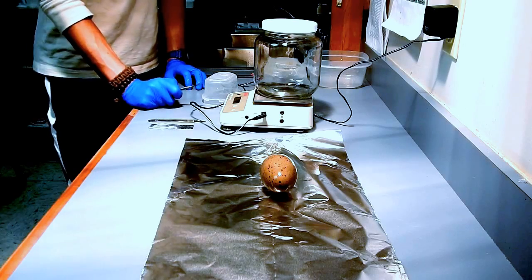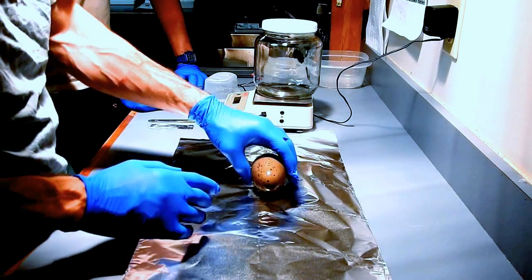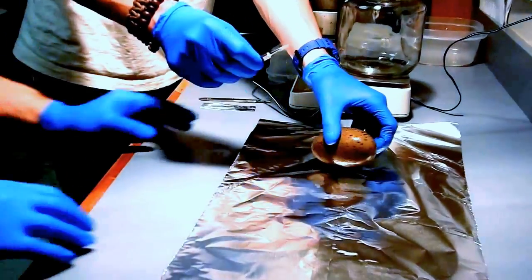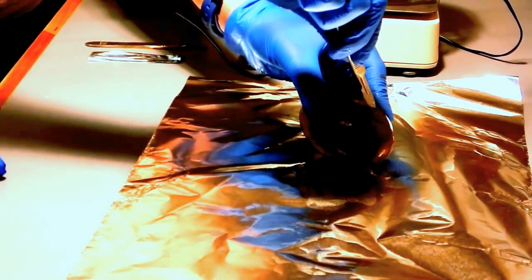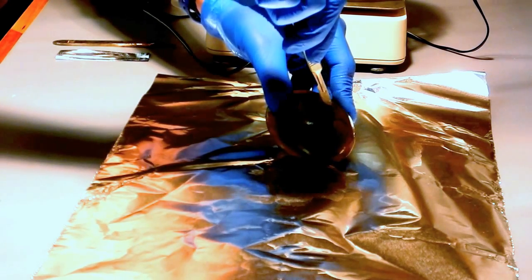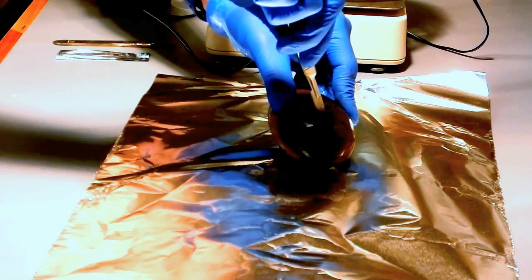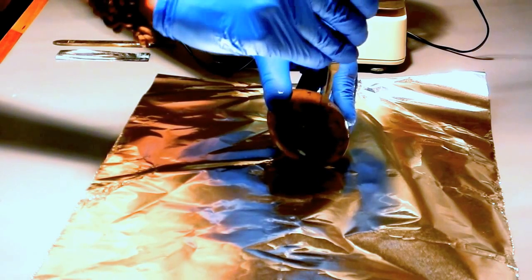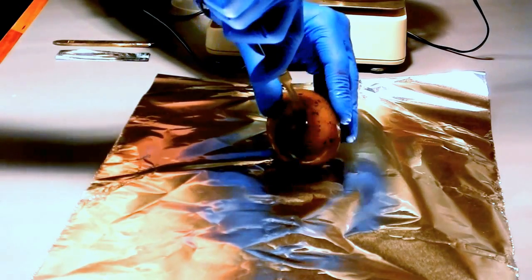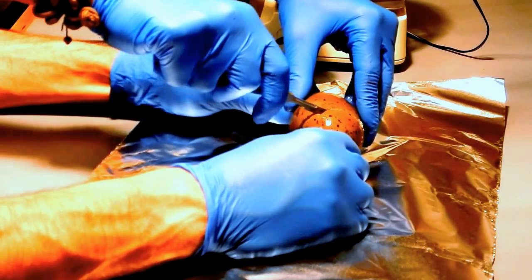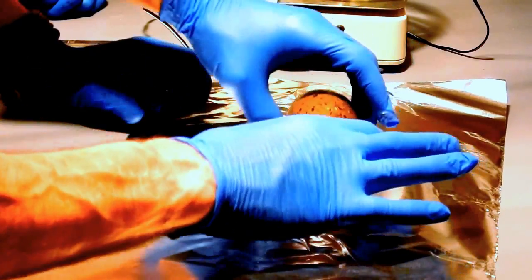And then, sometimes these eggs have a little bit of back pressure. You want to do the honors? Yes, you can. So, yeah, again, we were talking about cutting it around this end, and maybe we can tip it like that so we can see. You may be able to do it like an initial jab into the shell just to get the thing started. Before you get all the way through, let me just get this jar lid and set it in there as our little Petri dish.